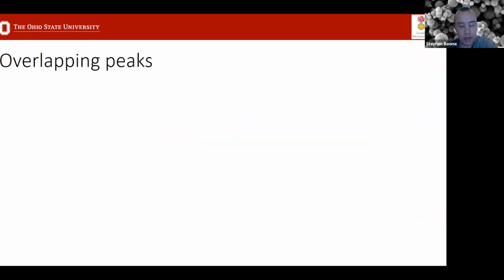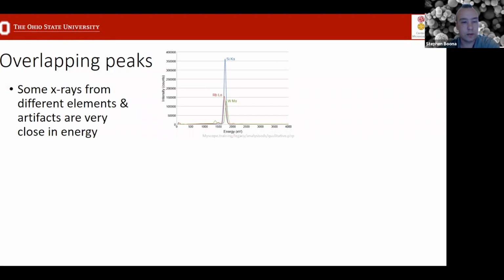Okay, overlapping peaks. This is another very common way that you can get some errors in your analysis of your data. So I mentioned early on that the characteristic X-rays that are generated are fingerprints of the elements, and that is true in the sense that the location of these peaks on the spectrum is very specific to the element. But because there are multiple types of transitions that can happen, sometimes you get coincidences where different elements will have different types of transitions that are all close together in energy. And in this case, these are 3 transitions very close to about 1.7 keV.